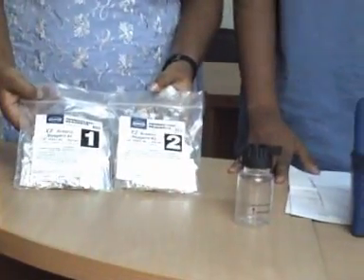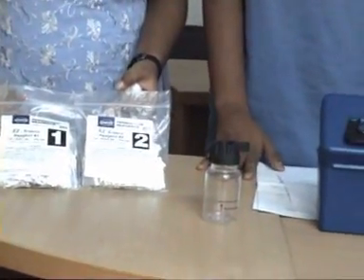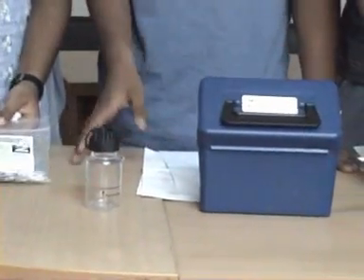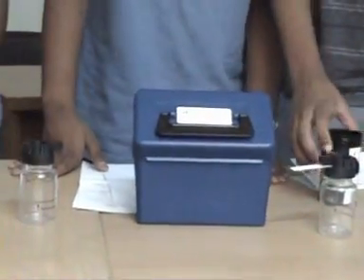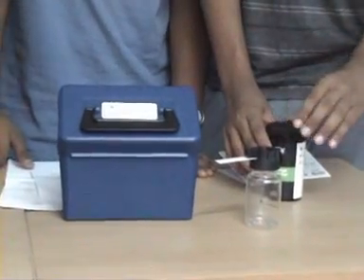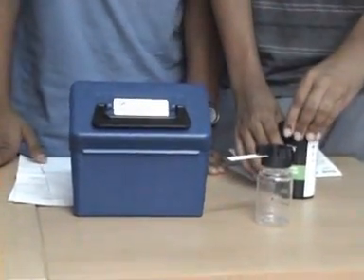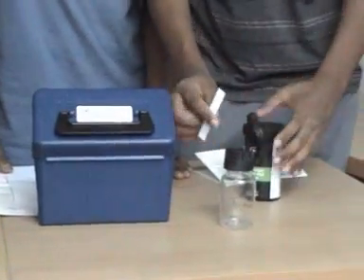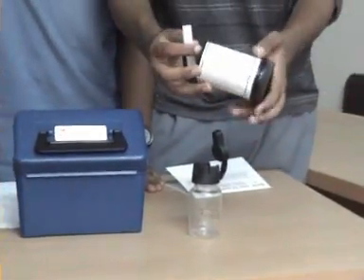Then we checked for a bad smell like rotten egg, but when we didn't get the smell, we added reagent 2 in the bottle. We then quickly fixed the cork on the bottle and kept it for 25 minutes.